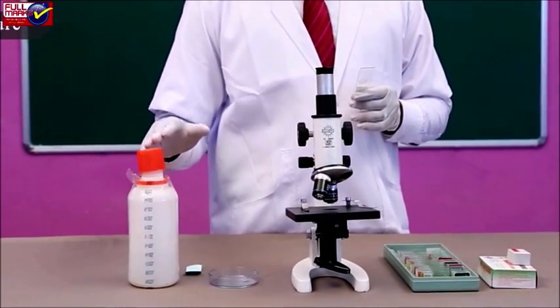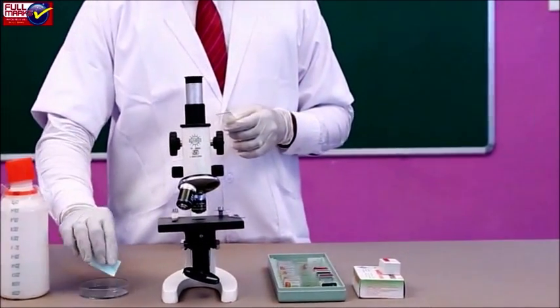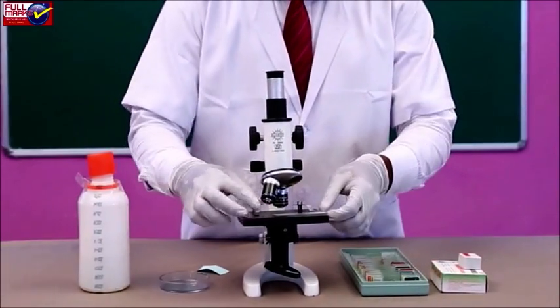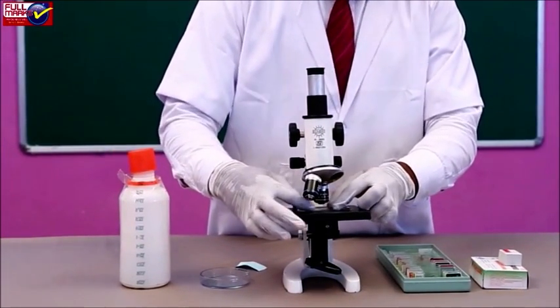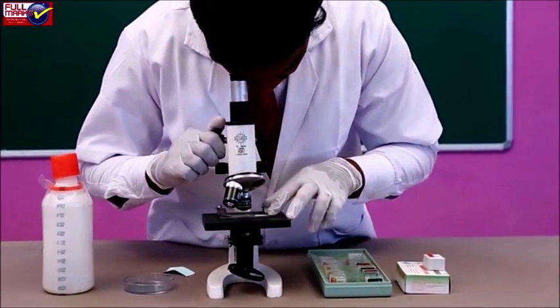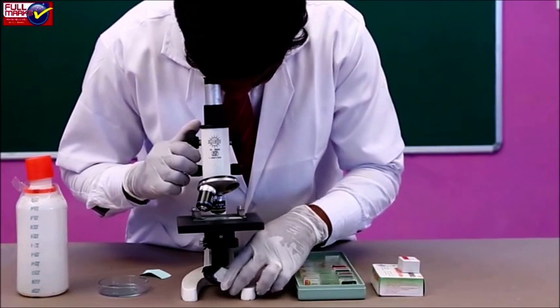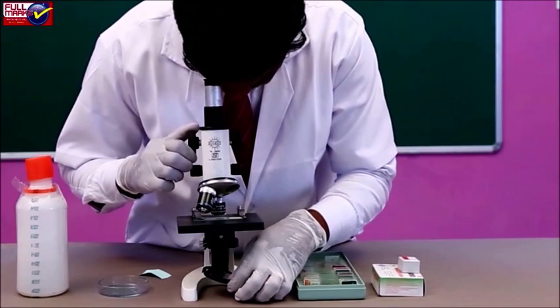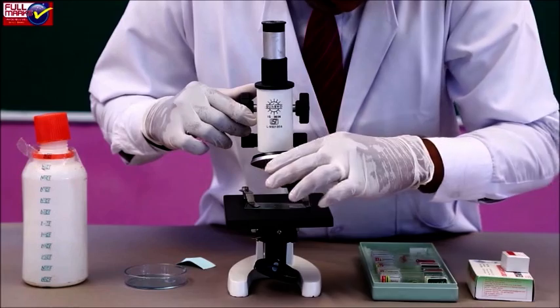Procedure: clean the slide and microscope eyepiece and objective lenses with lens cleaning fluid and cleaning paper. Place the slide on the stage of the microscope. Observe the slide of TS of mammalian ovary first under lower magnification and then under higher magnification. Draw and label the various stages of gamete formation.